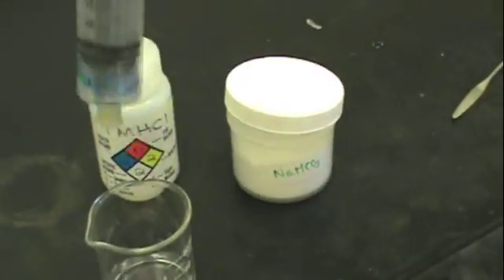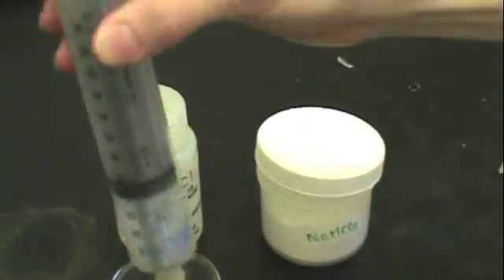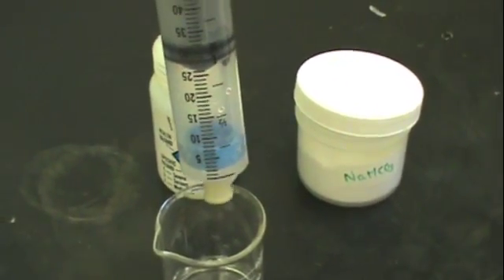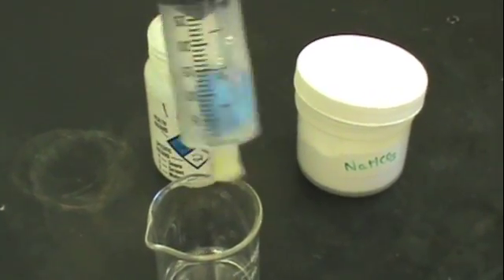Now shake your system to start the reaction. As sodium bicarbonate reacts with HCL, you will liberate CO2, which will push the plunger out.